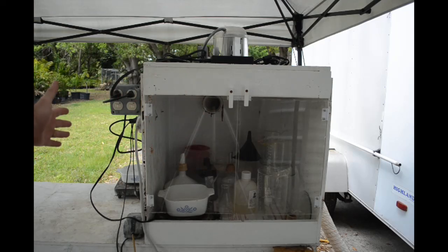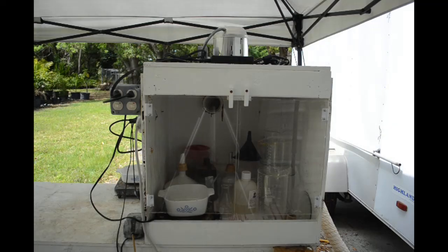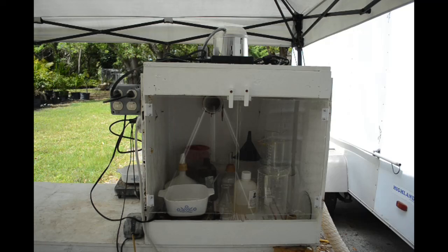If I have any complaints about the box it's a little small. It could be bigger, wider, and taller. But I doubt anybody has a fume hood that's big enough for everything they want to do. At least I can do the really nasty stuff in here so I don't have to breathe the fumes.